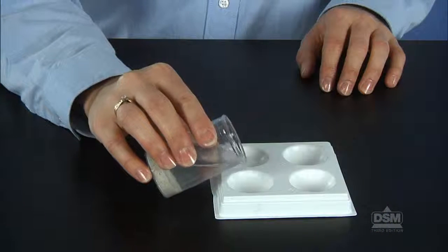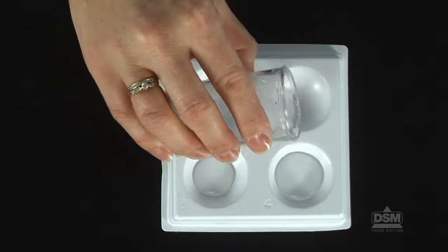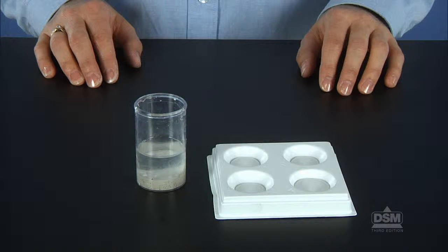To conclude Session 2, demonstrate for the class how to pour liquid from a vial into an evaporation tray without transferring any solid material. Then, distribute the evaporation trays and instruct teams to pour the liquid carefully into each of the 4 wells in the trays. Students should place the trays in a warm, well-ventilated area. Do not allow students to pour the sediments down the sink drain, as solid particles should always be discarded in the waste can. Vials and caps should be rinsed, air-dried, and returned to the kit.